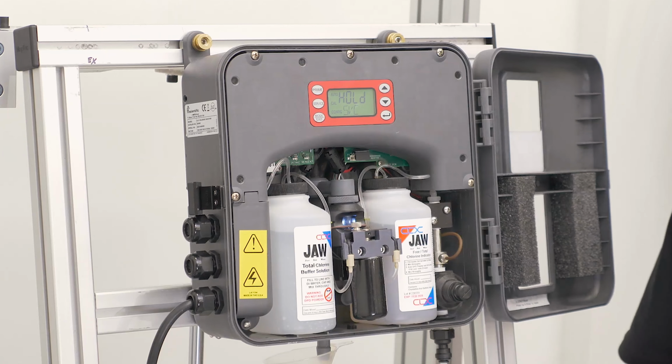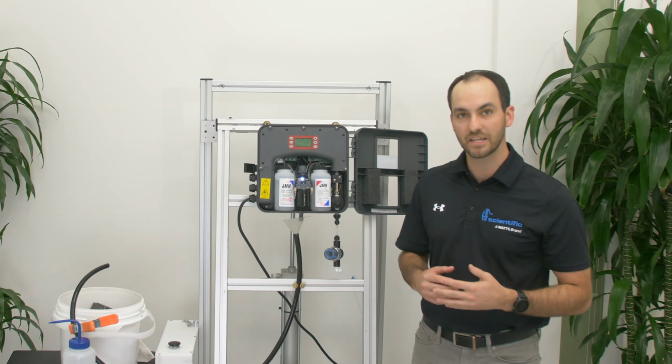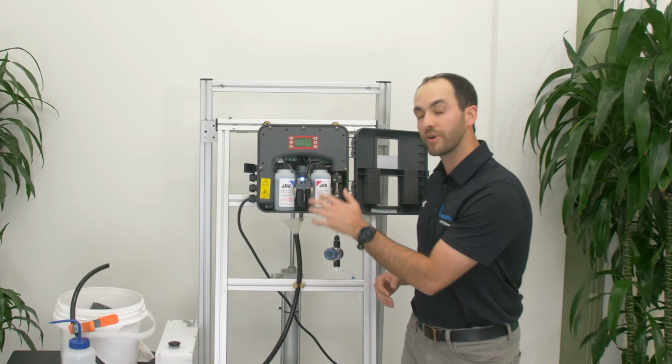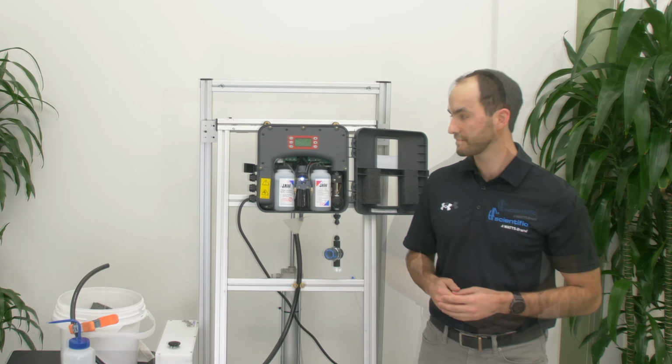As we can see, there's no water. We know it's drained, and we can say that our intake solenoid is not leaking by. If there was water coming into the cuvette at this time, when you verified that it's drained, then you know you have an issue with your intake solenoid.